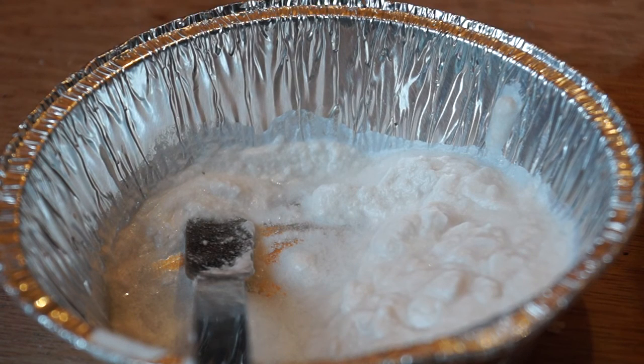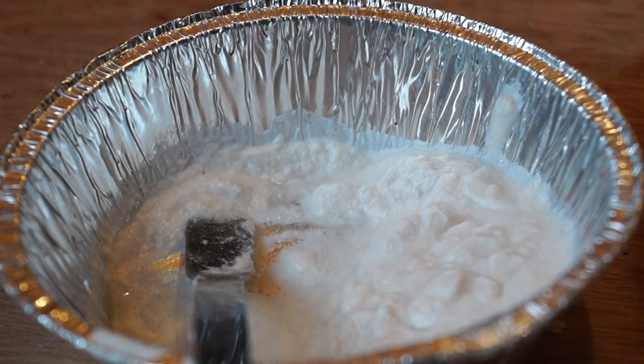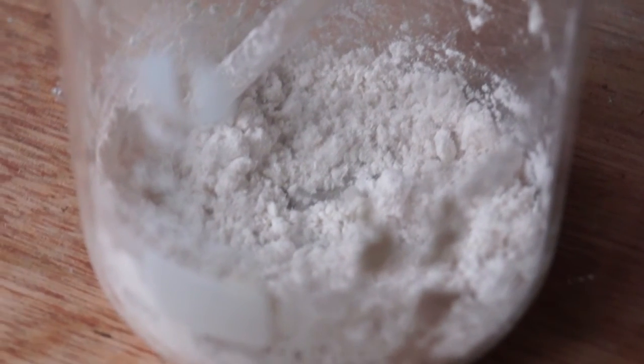Once your precipitate is separated, leave it to dry. This gives you a crude salicylic acid product. To achieve a higher purity, you can recrystallize the product and dry it again for use as a precursor in other reactions. In this case, I did not.